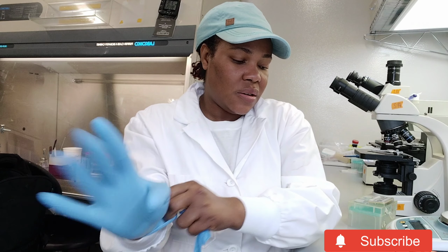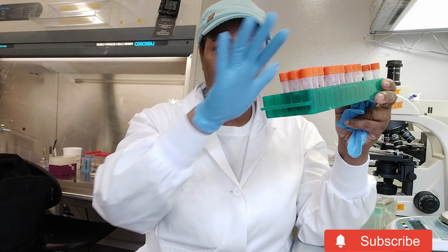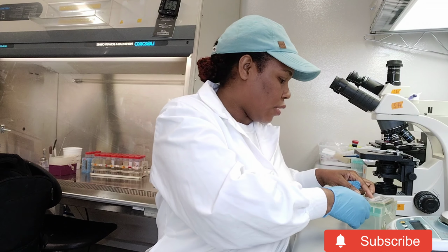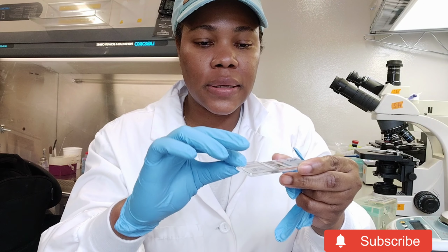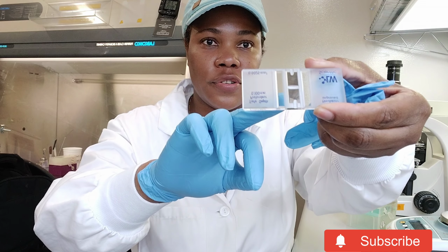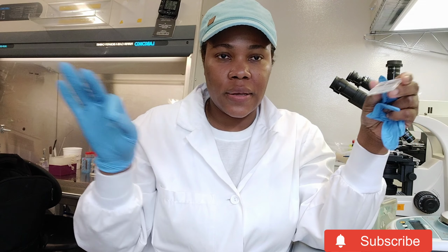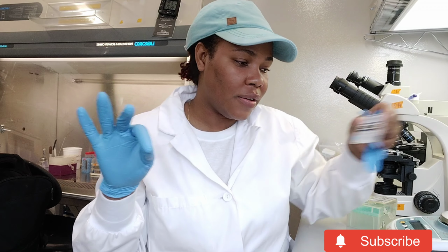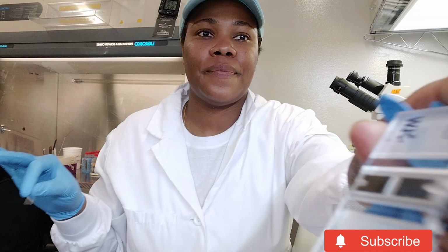But I am going to take 10 microliters from each of these. I have 27, and I'm going to put it on the hemocytometer. There are 2 chambers, and take a photo of both chambers for each of them. And then tomorrow or Friday next week, I'll go through and count so I can compare across the 27 which has the most and stuff like that.